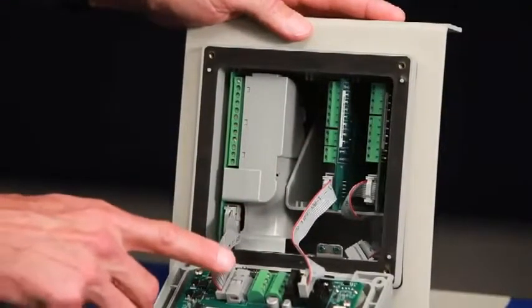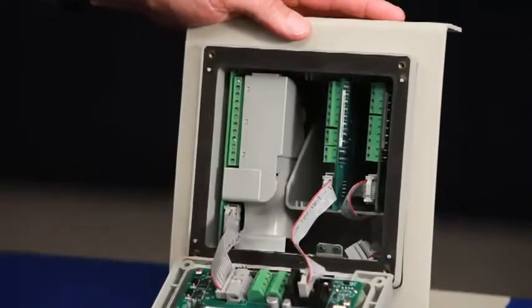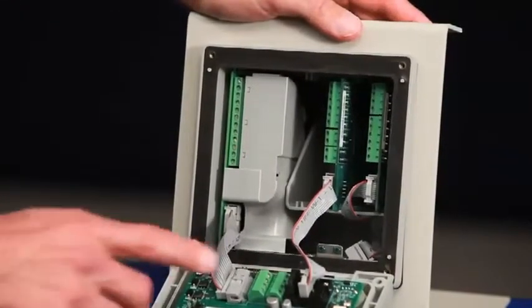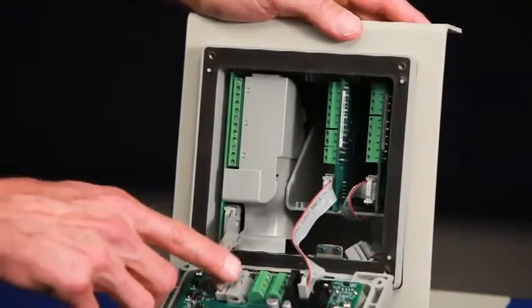The current outputs on the main printed circuit board are also ergonomically designed to allow for easy insertion of the wire leads.